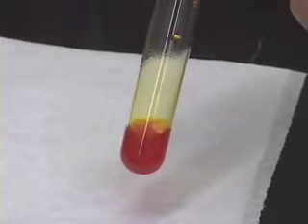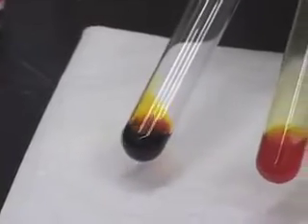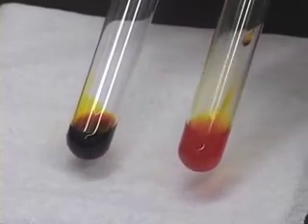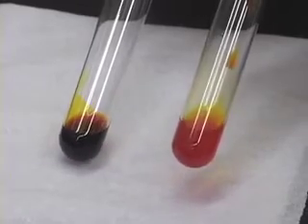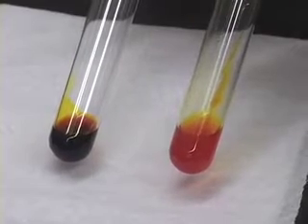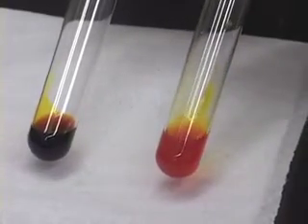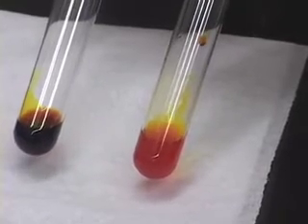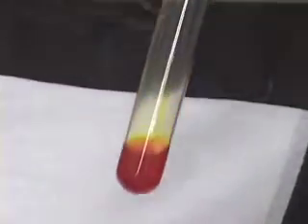We noticed that you don't get a blue-green precipitate. In fact, this is a concentrated reagent which is yellow-brown in color. When we add it to our test compound, it is still yellow-brown — it may look a little dilute because we added one milliliter of acetone. There was no blue-green precipitate appearing in this test tube which had a tertiary alcohol, indicating that tertiary alcohols do not react with chromic acid. So this is a negative test result.